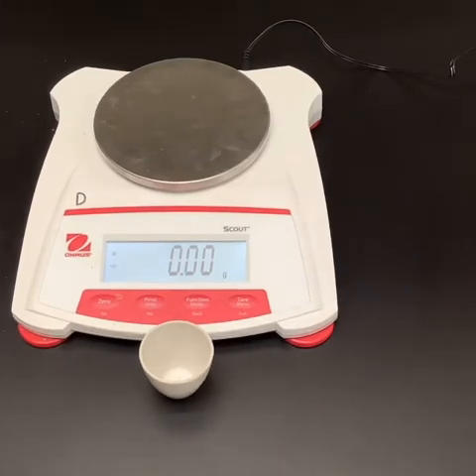All right, guys, today we are going to be doing a lab, and the lab is going to be working with a chemical that most of us at some point in our lives have come into contact with in our kitchen, and that chemical is baking soda. We use baking soda for lots of different things.